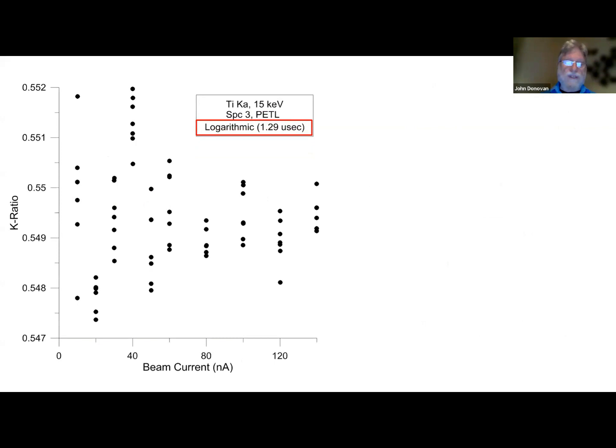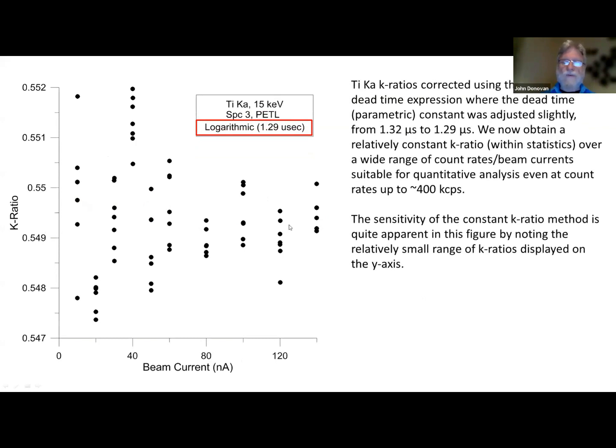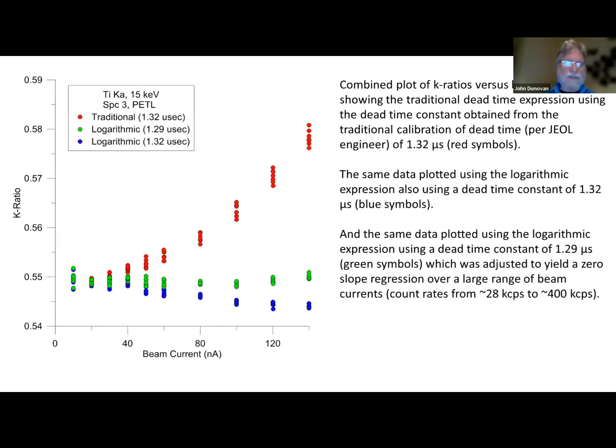This is what we should be seeing from 10 nanoamps to whatever, 200 nanoamps, 160 nanoamps, whatever. So this means we can get up to about 400,000 counts per second. Above that count rate, things start going haywire again because we're getting saturation of the detector, and the electronic circuits become completely sensitive to the slightest change. So at least with the current electronics, we can't do much better than this. But it's still a 10-fold improvement, and this is kind of just a summary.